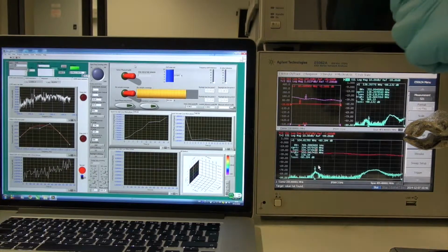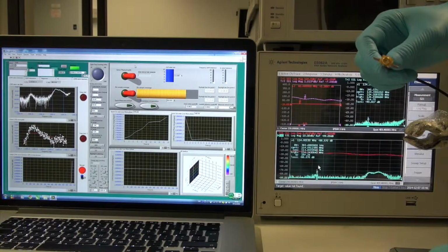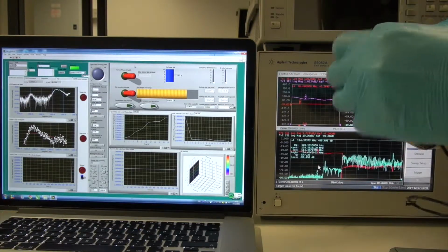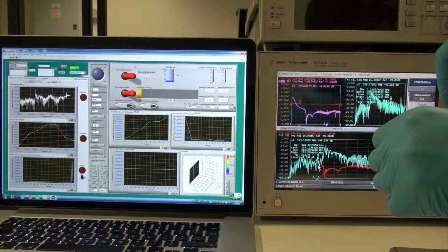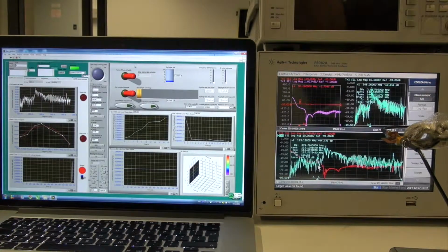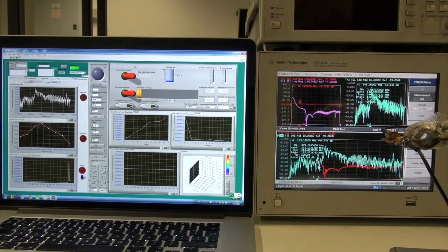If we connect this device without any zinc oxide layer, we can see the zinc oxide layer only has 1.13% left, which means this device is almost dead because the guiding layer has been dissolved by the solvent in the microfluidic chamber.